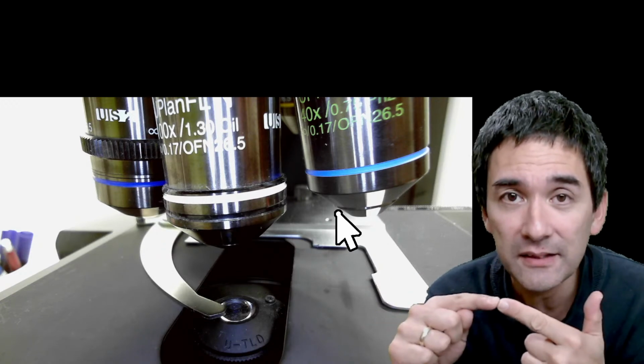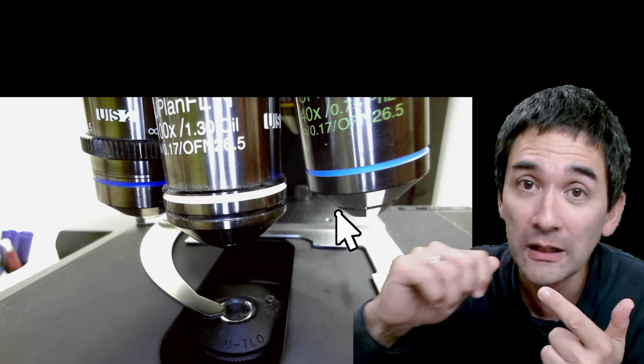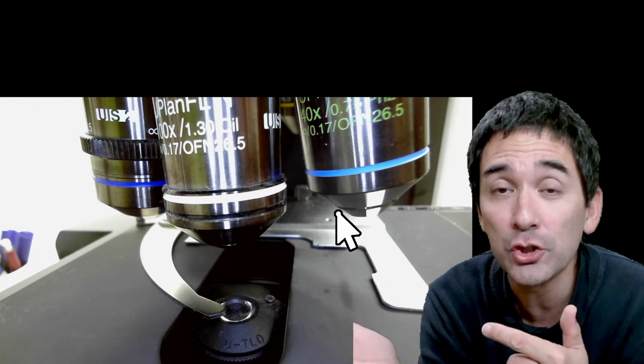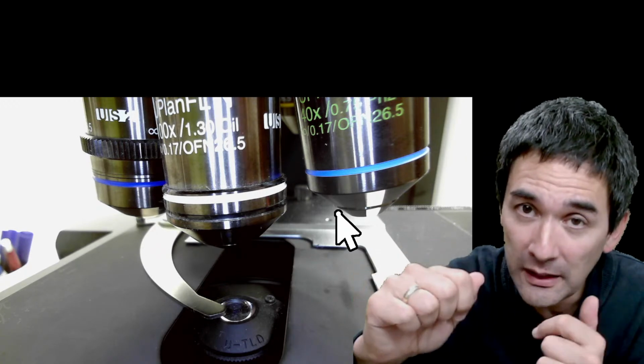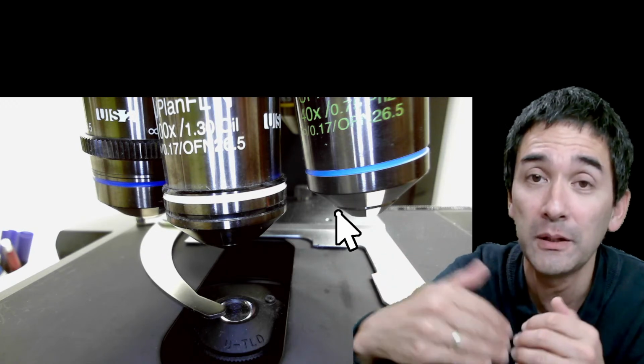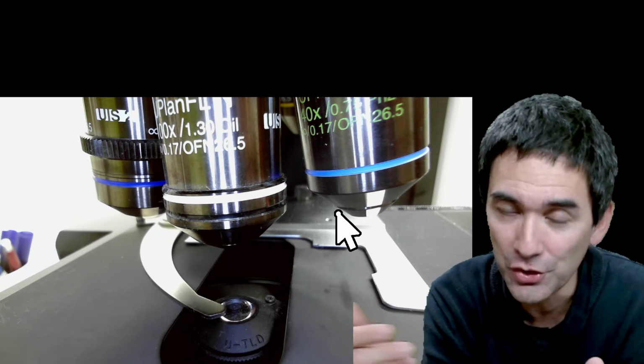The second disadvantage is that if you do photography and you change the light intensity, then you essentially also have a change in color. If you turn down the light intensity, the color becomes more red. If you turn up the light intensity, the color becomes more blue. So you have to work with white balance when you take pictures.